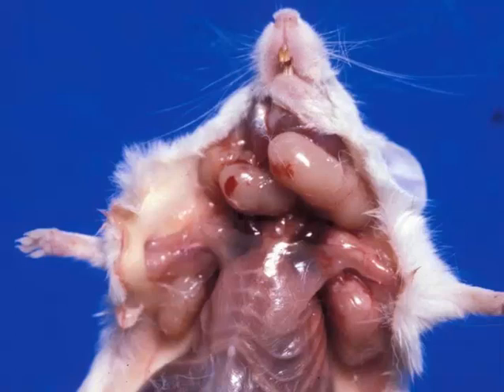In the mouse, as we said before, most if not all lymphomas arise as a result of retroviral infections, and most lymphomas are of B or pre-B cell origin and tend to arise in the spleen. This particular mouse, although we cannot see what's going on in the spleen, has all of its lymph nodes very enlarged.